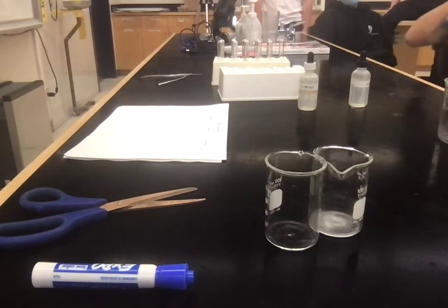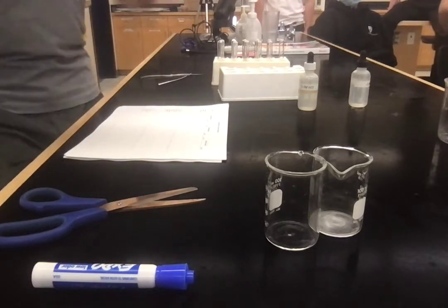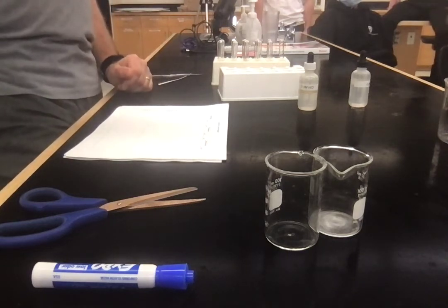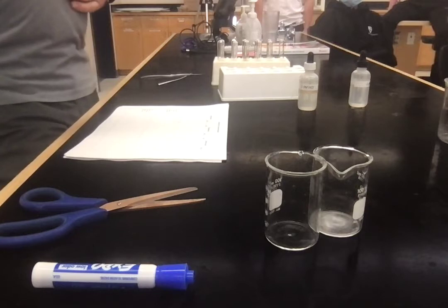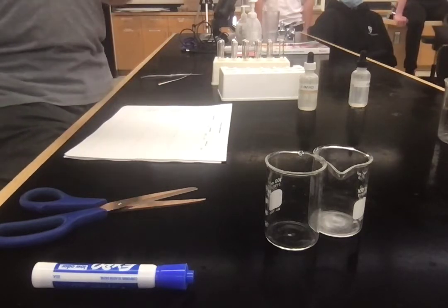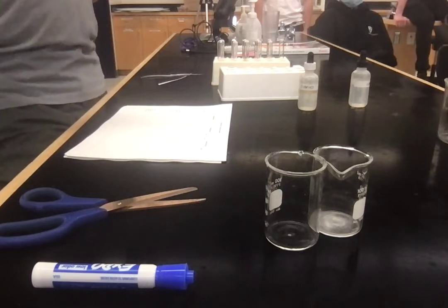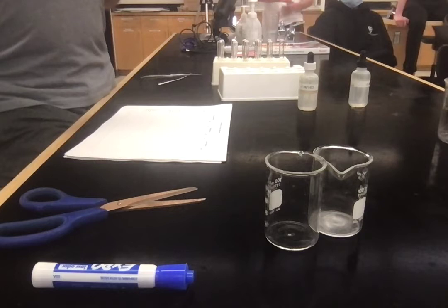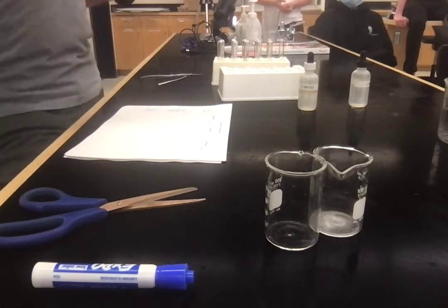In this one, we've got way more HCl than we actually need. That's just a fact. So the magnesium disappears. You've got to think about, what can I measure over time? What's happened to the fizzing? Okay, so you could think about fizzing over time. There was a gas being produced. How could you measure the amount of gas?